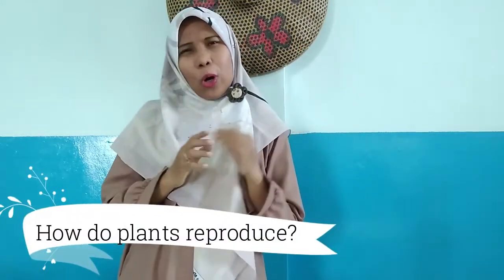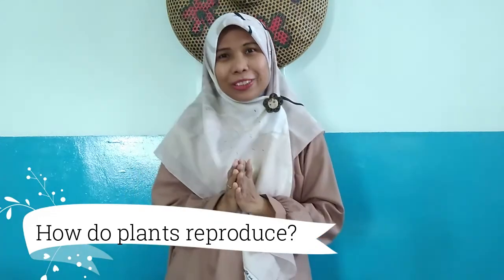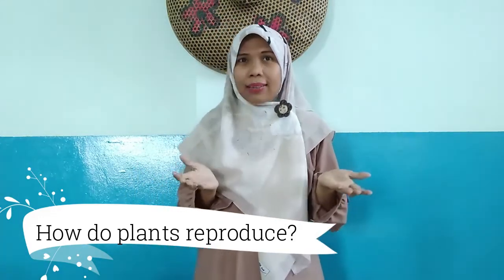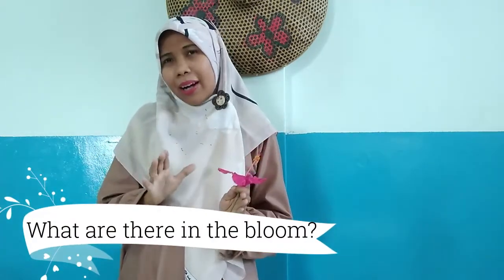Have you ever wondered how do plants reproduce? What are they in a bloom or a flower? So today we are going to dissect a flower to find out what are there in the bloom.